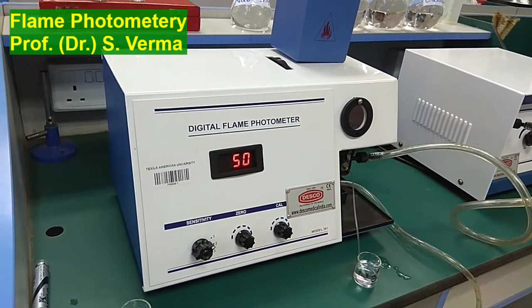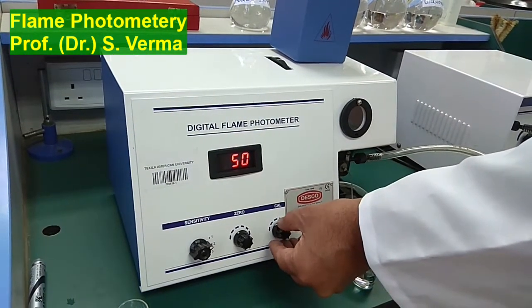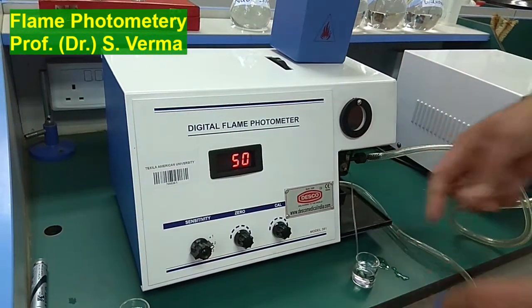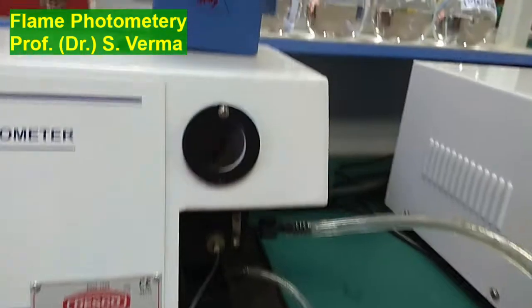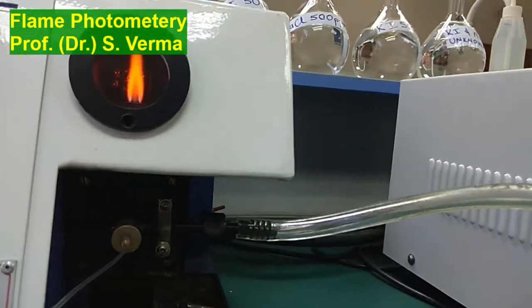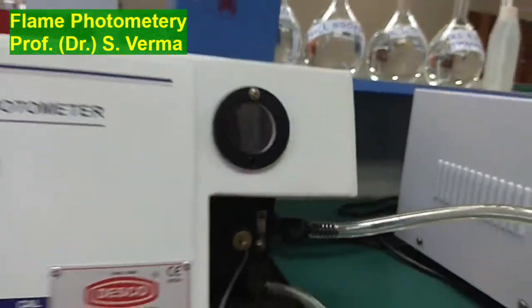Once it is being set at 50, you can work with your test solution. So I'll take this out. One more thing is, with sodium solution, the flame color should be yellow. The sodium ion gives yellow color. So you can see that blue flame has now changed to yellow.